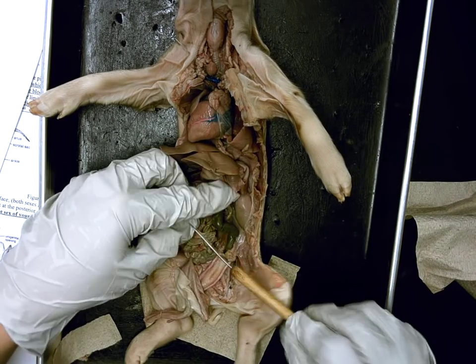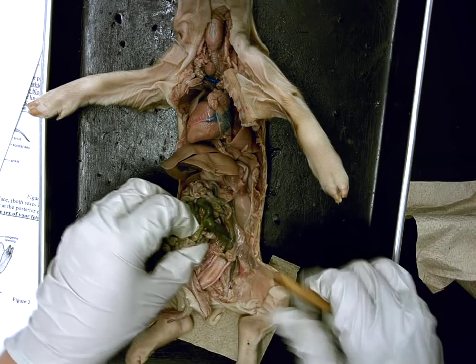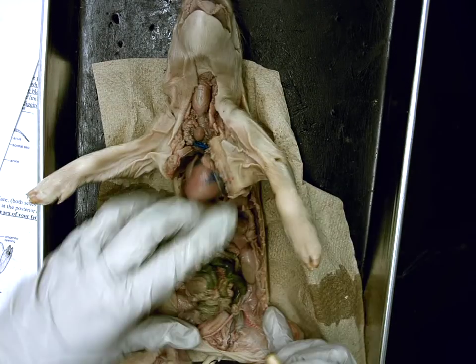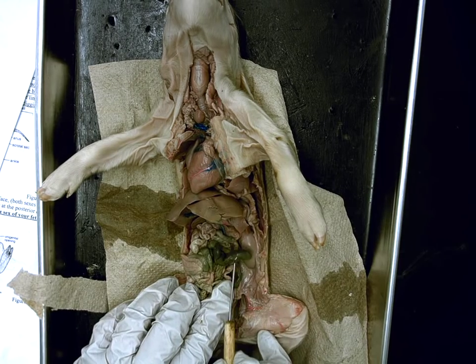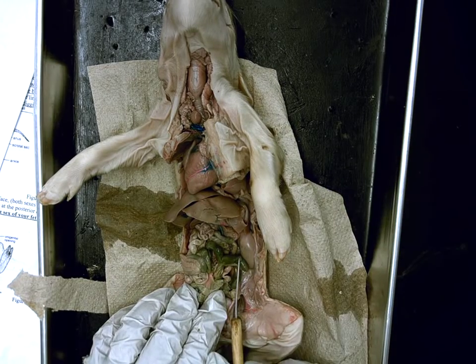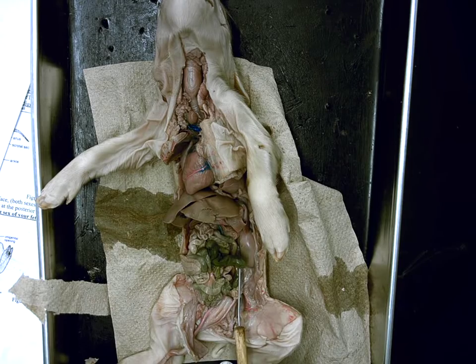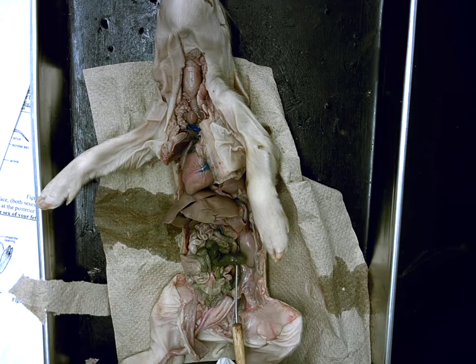If I tilt it over to the side — this has a function in other animals but has lost its digestive function in us. Let me put this under a paper towel to show it a little better. There's the skinny small intestine tube, which then comes out into a tube that goes absolutely nowhere, and then it becomes the large intestine tube. This little extension tube is called — Samantha? Cecum. Function? It pretty much helps digest cellulose.